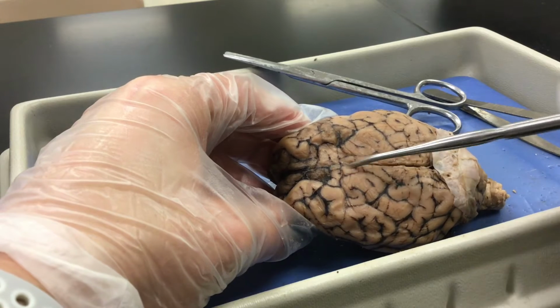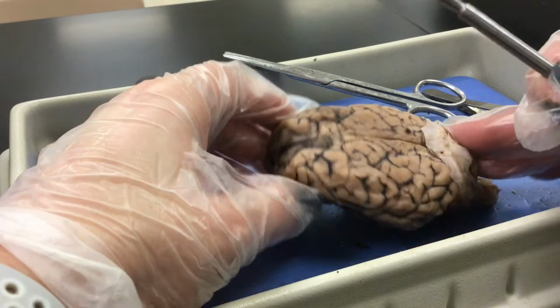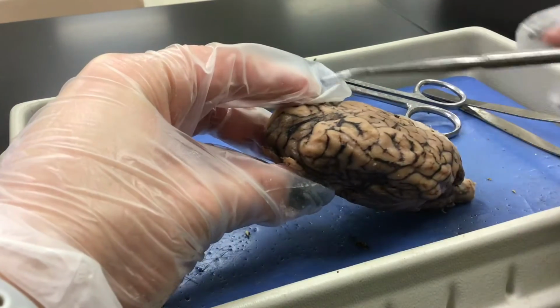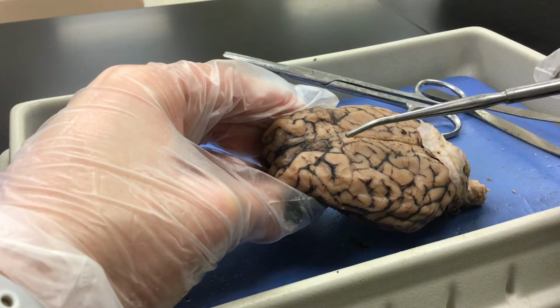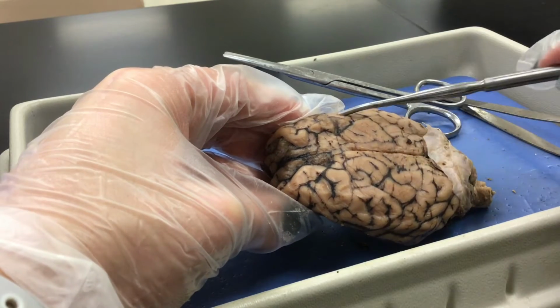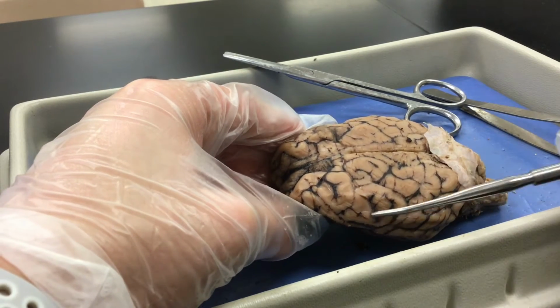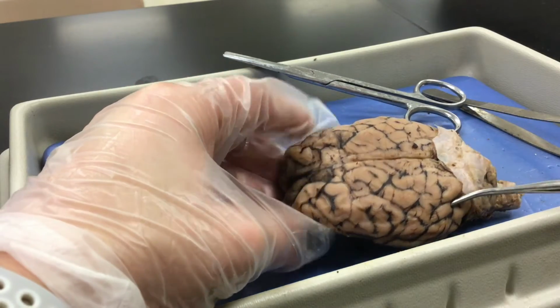There is the medial longitudinal fissure, and we've got the four lobes of the brain in the cerebrum. The frontal lobe, which for the two hemispheres is right here. If you're just looking at one hemisphere, it'd be right here. And we have the central sulcus here. Parietal lobe, so for both hemispheres, parietal lobe. Then we have temporal lobe here, and the occipital lobe in the back.